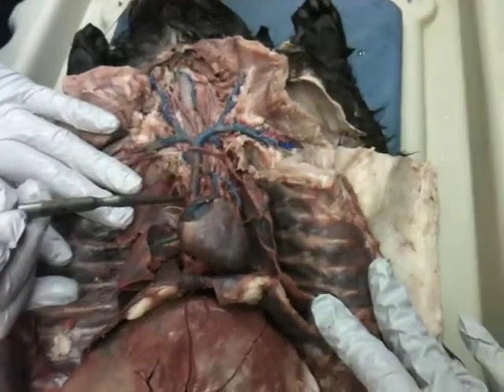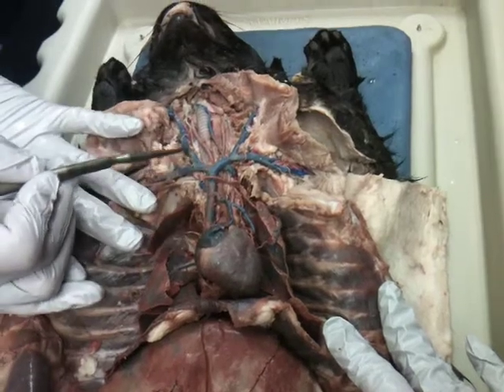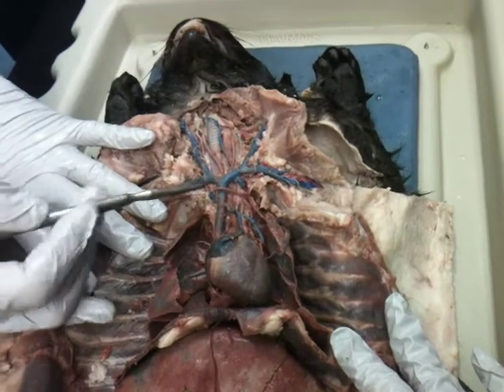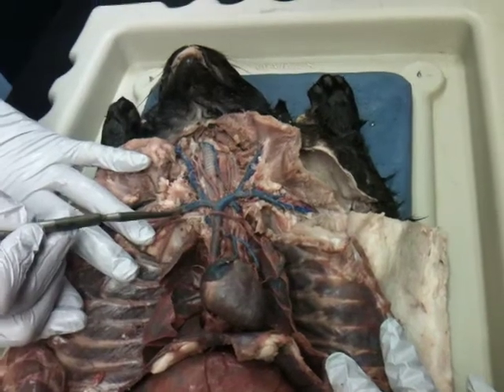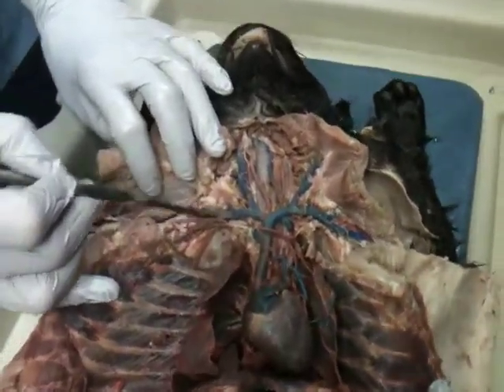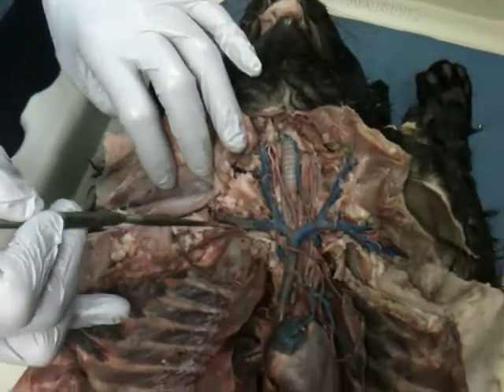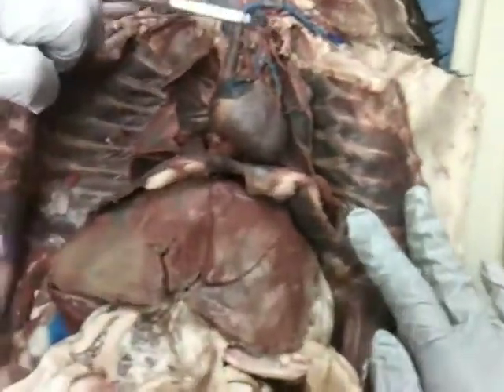So we have gone from the superior vena cava, dividing into the brachiocephalic vein, going up to the external jugular vein. When it divides, it then becomes the subclavian vein. It'll continue on to be the axillary vein. It'll send a branch off here. It goes deep. It goes down to the scapula. So we call that the subscapular vein. Once it divides off there, it continues on as the brachial going down the arm area.